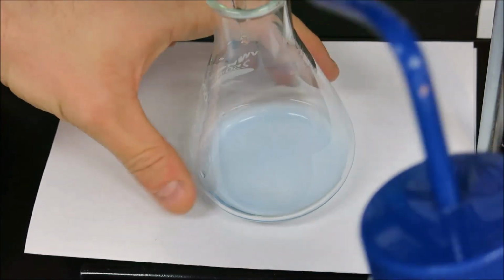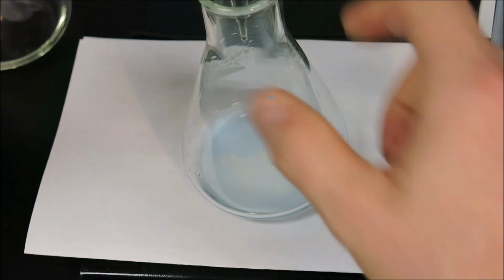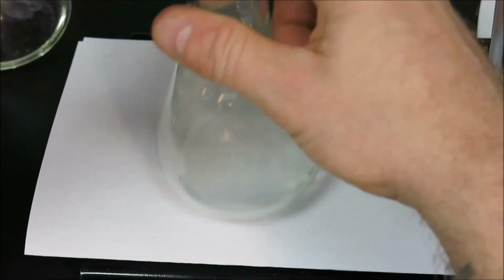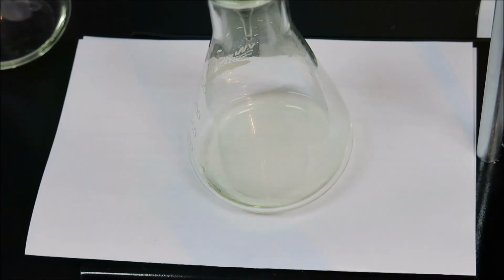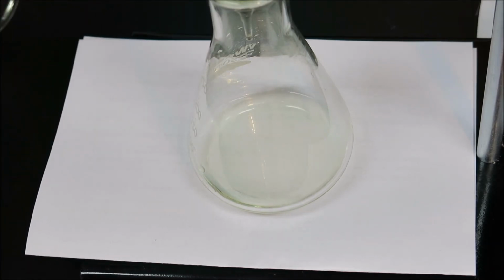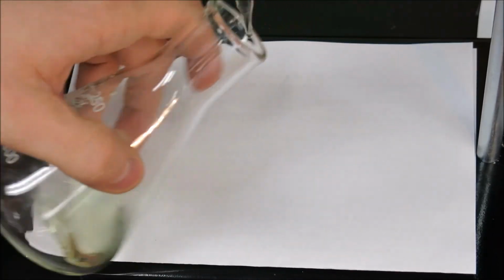Now, my color is blue, but I have a drop hanging, and I'm going to add that drop using a little bit of water, and I can see the color is there, and will the color fade? And just with that little portion of a drop, we actually passed green all the way into yellow, which indicates even a half a drop would have brought us right into our endpoint. Now, while it is also yellow, it is not as yellow perhaps, and it definitely is not a full overshoot like the first trial.